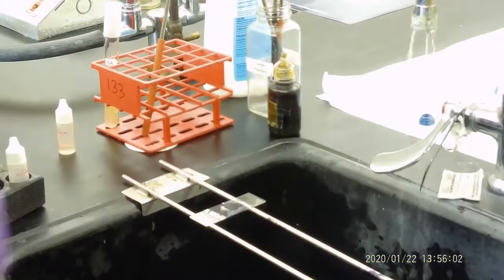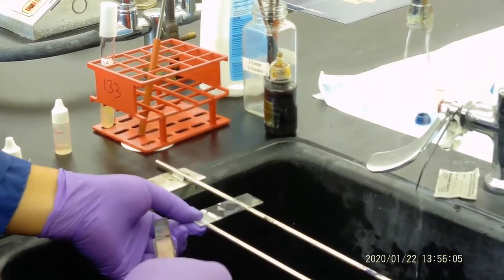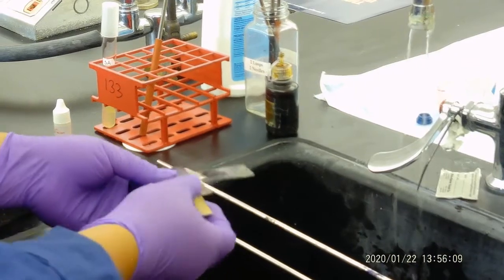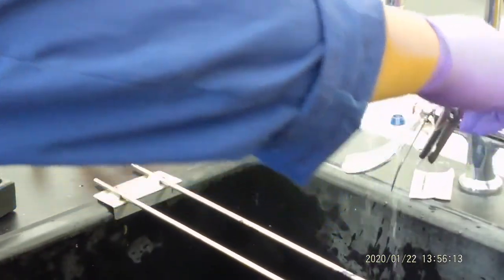So next step, we do the rinse. Now, before you do the rinse, make sure the tap water is running, but not very dramatically and very severe. So we put this side and then we do a very gentle rinse.